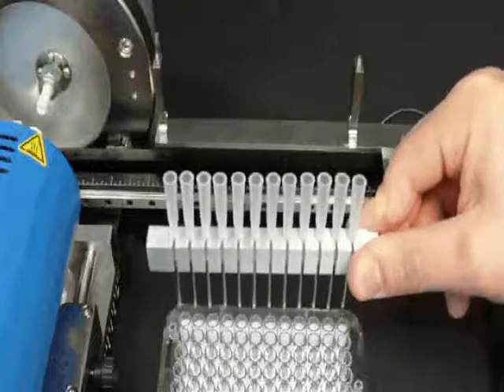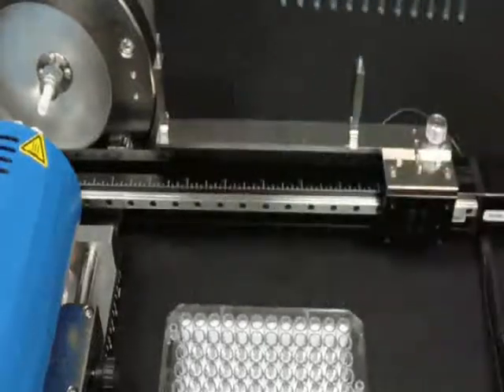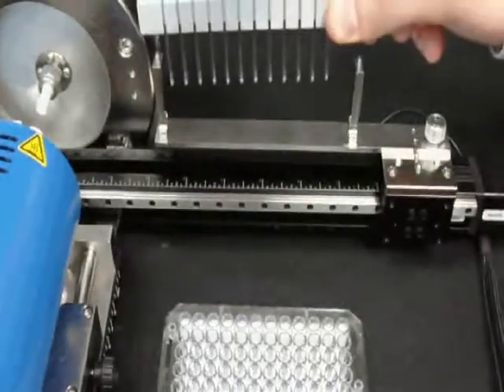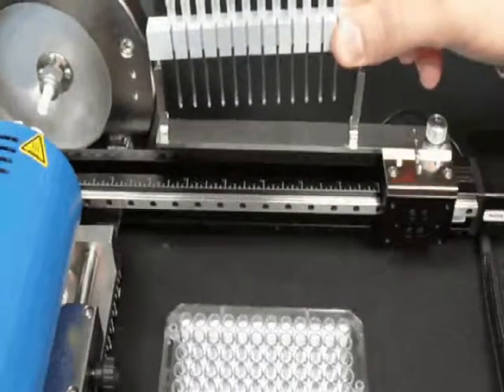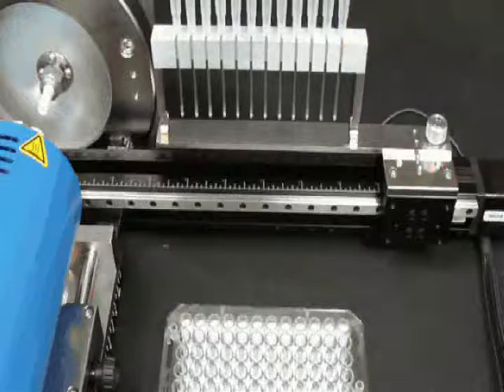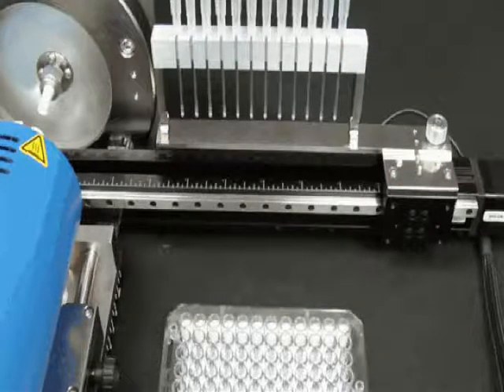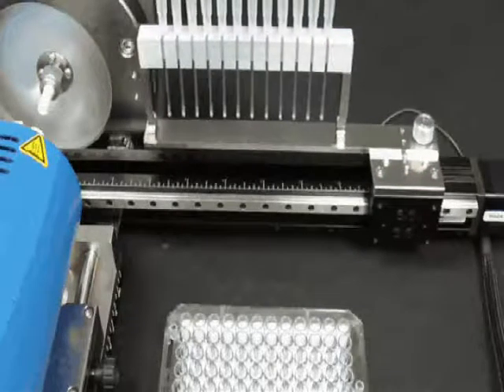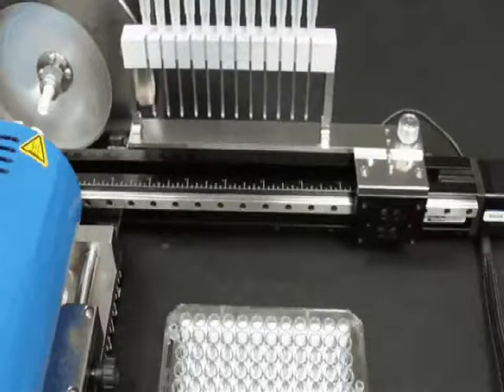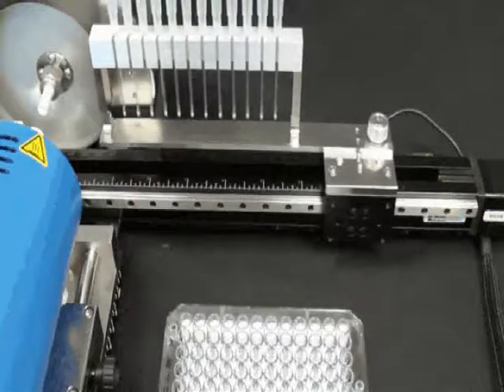In this case, 12 samples of milk are placed into the vials of the plate. The samplers move to the linear rail actuator of the DART SVP.